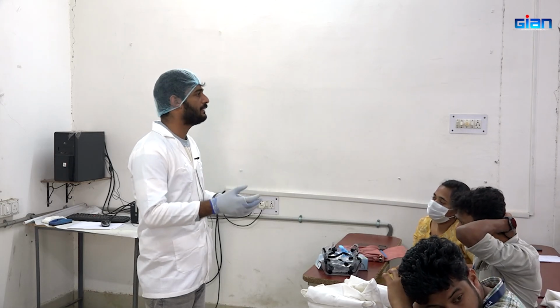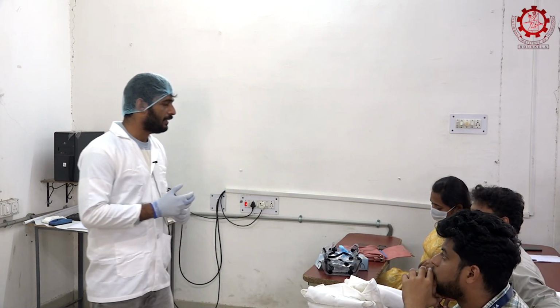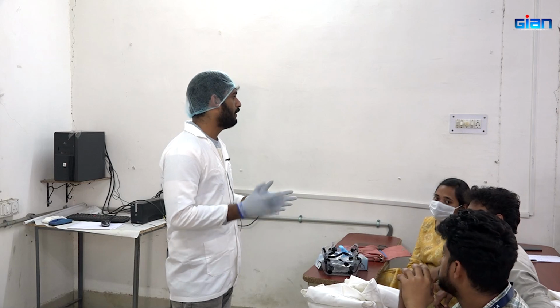After that we went for the next step. What is the next step? Demineralization. For demineralization we used HCl and acetic acid, and we didn't use citric acid. One organic and one inorganic acid we have used. And after demineralization, what is the next process?